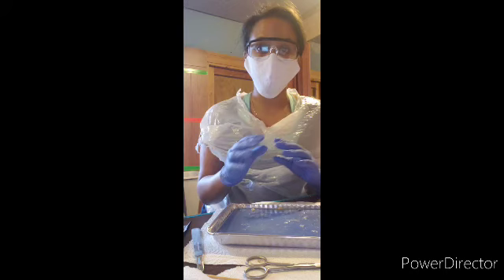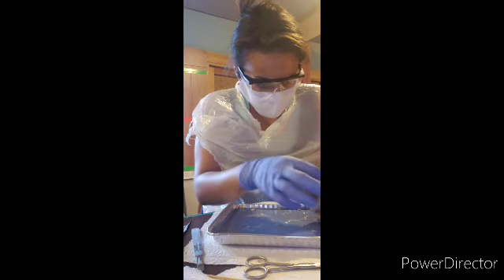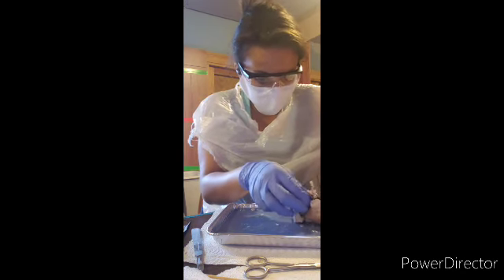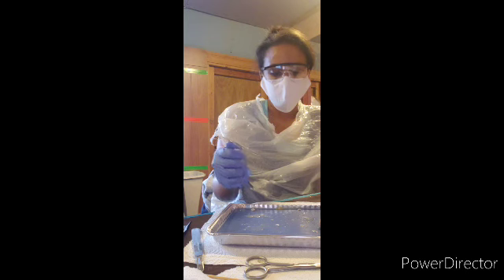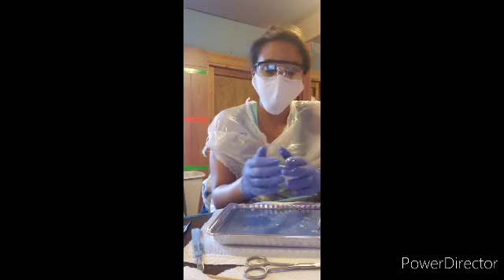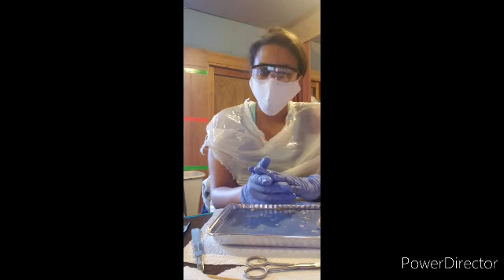Now, if I did this wrong in some way, I am very sorry, because I can't tell, because I know there's tough tissue for the area of the brain, but other than that, I can't seem to find it. Now, if I did it wrong, I do apologize, but hopefully I did this correctly. I did my best, and hope you guys enjoyed it.